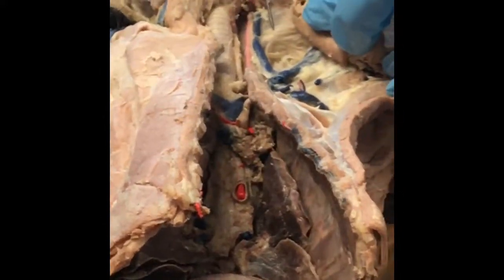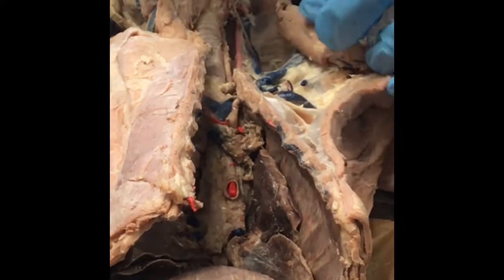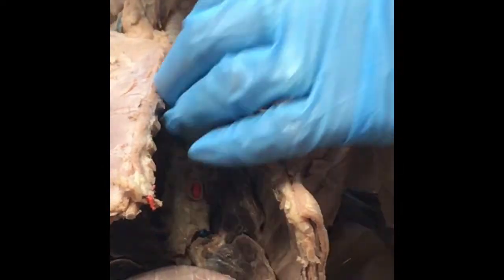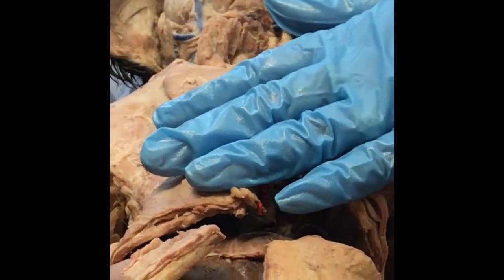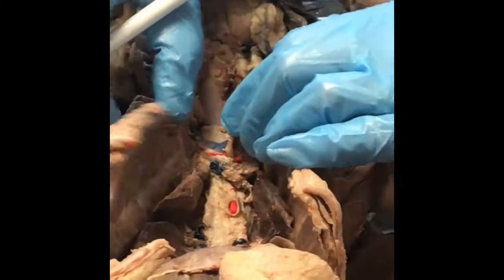I'm not going to worry about internal and external jugular. I will just have a pin in this, and if it's blue, you're going to say that's the jugular. You with me on that? Yep. Okay. So then that leads up to the jugular. Those are the main ones that I want you to know for up above.